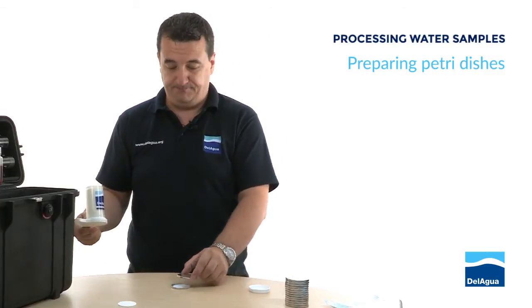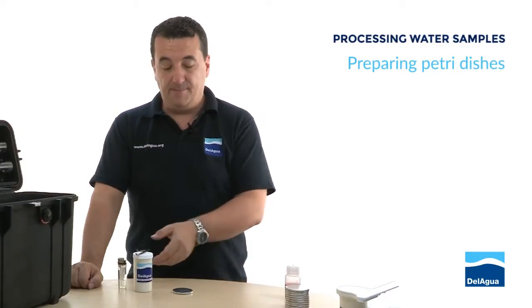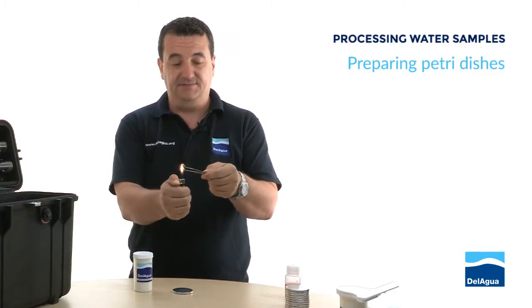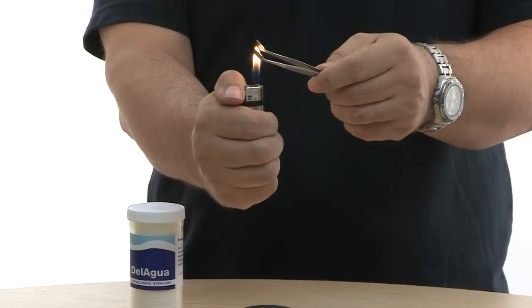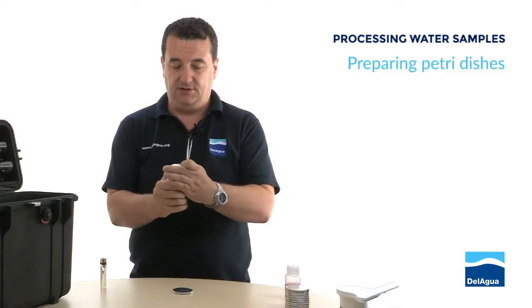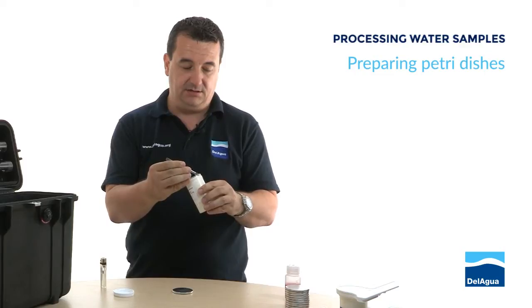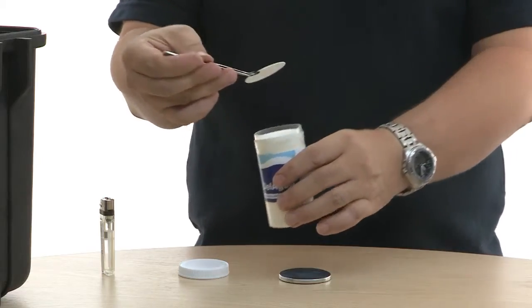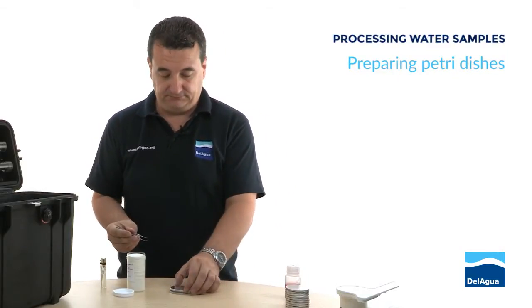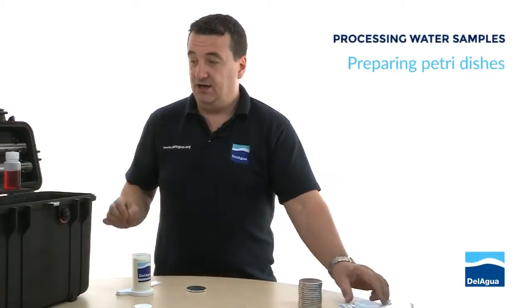Ready for us to put some media on. What happens if we haven't got a pad dispenser? We want to make sure that the pads remain sterile, so we can use a pair of forceps. If we flame the tips just to make sure that we kill anything that might be transferred, then without touching the ends you can very simply take a single pad and drop that into the petri dish in exactly the same way.